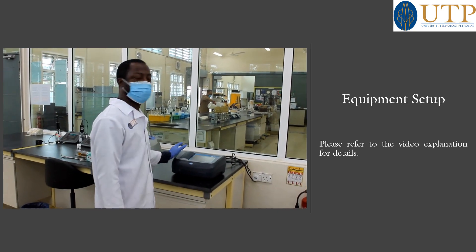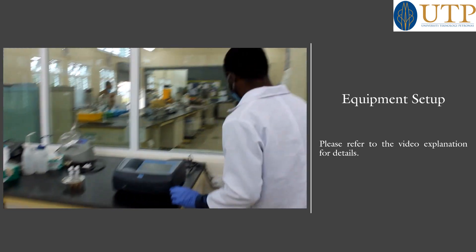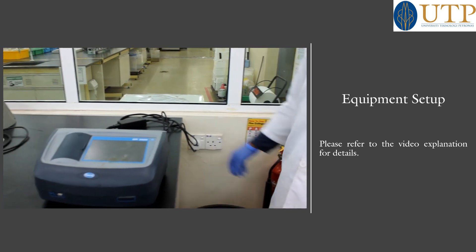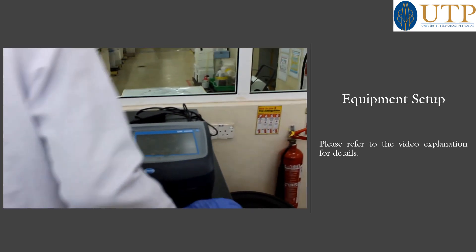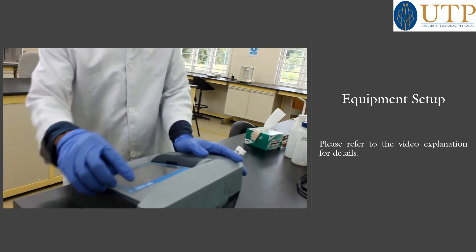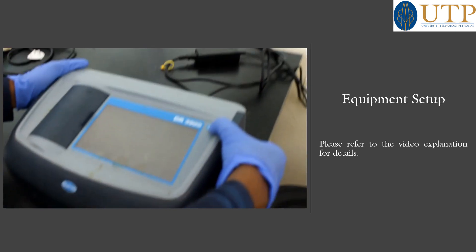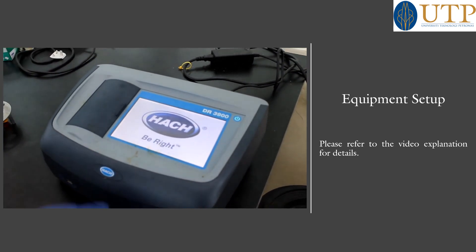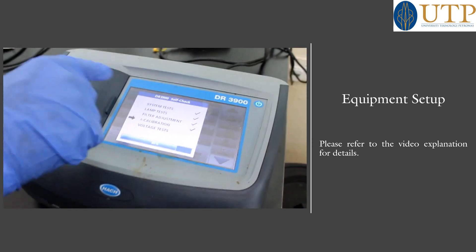Now we are going to switch on the photometer. You can see the switch is off, so we start by holding the switch. We check if the plug is okay — plug is okay. Then we turn it on from the on button. Press the on button. This is the DR 3900. The DR is running, doing the automatic self check.